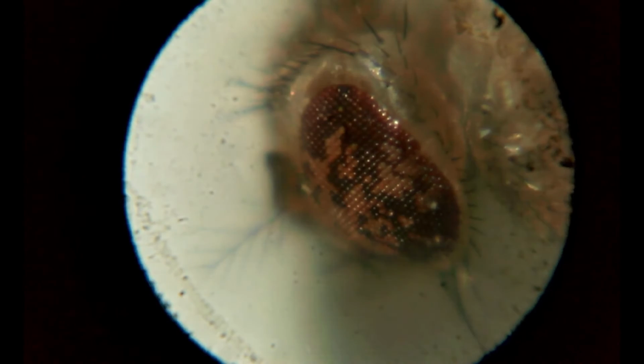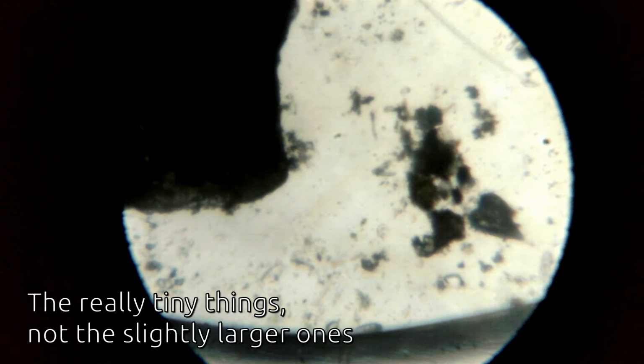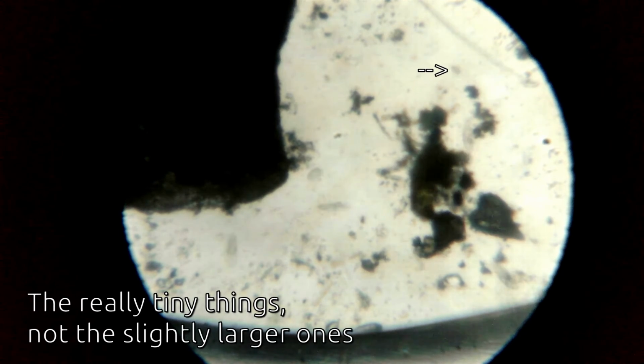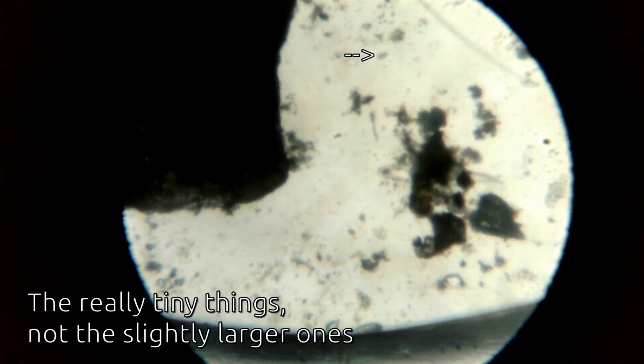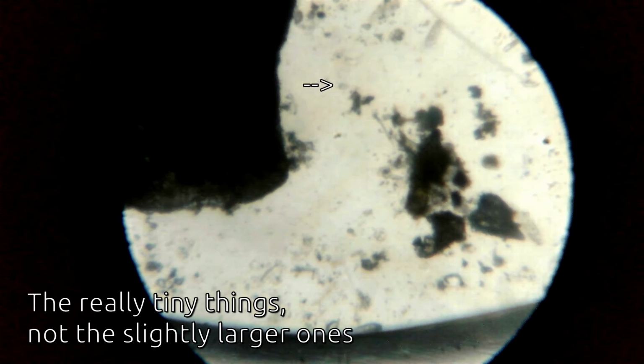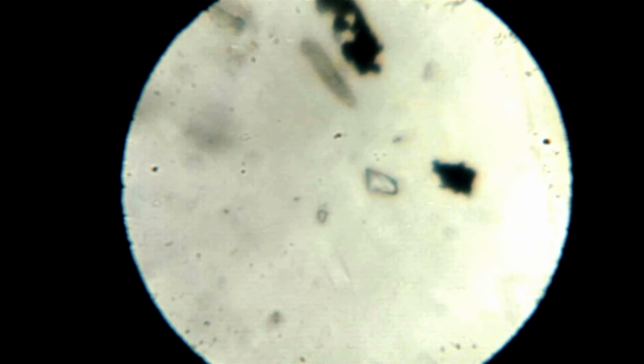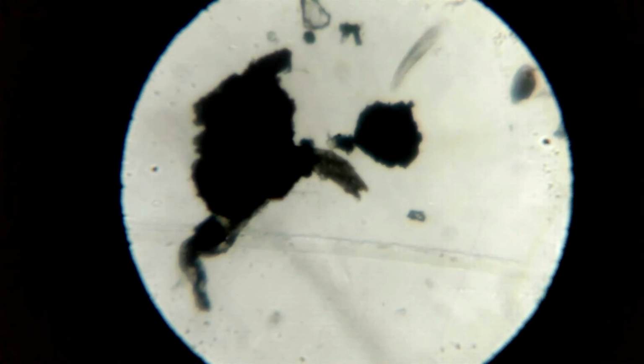Now let's find something that actually lives. I take some water from a muddy puddle and see what I can find. The tiny creatures that are speeding around all over the place are single cellular algae. And here are organisms that look a bit like house slippers. They are called Paramecium. In German they are called Pantoffeltier, literally meaning house shoe animal.